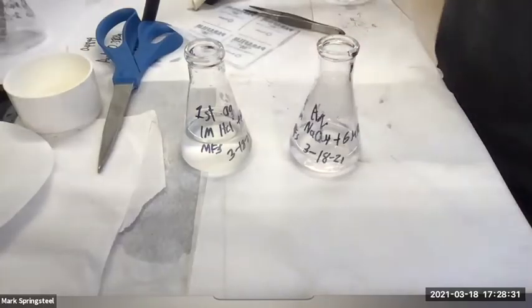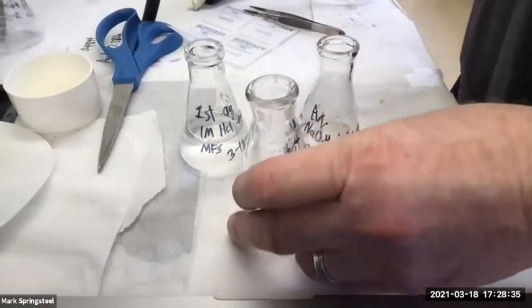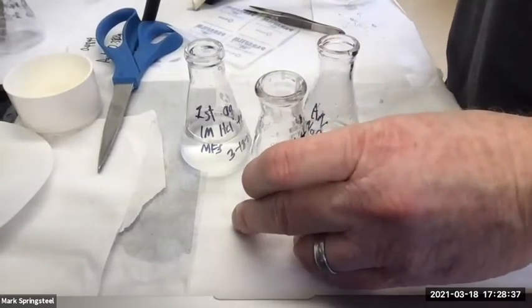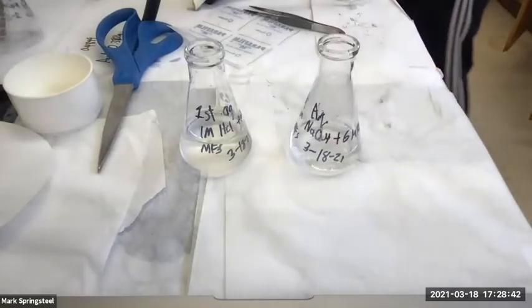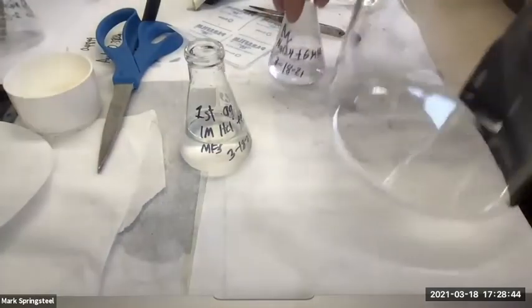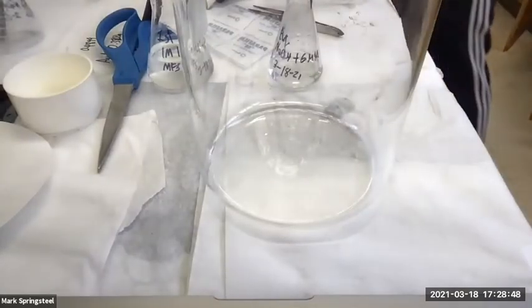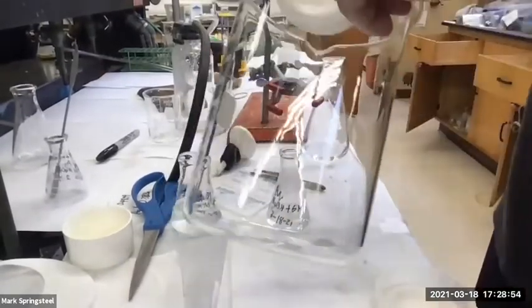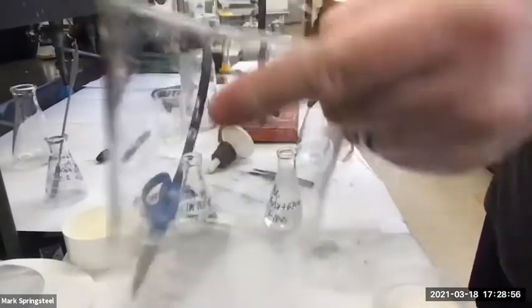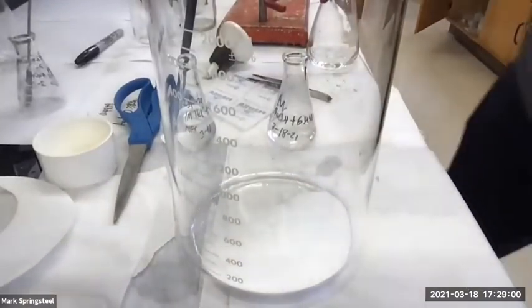And should I put the sodium bicarbonate in like a small Erlenmeyer flask and add the acidic solution? No. Why not? If you want it to shoot out the top, then yes. Yeah, it can volcano out, huh? So instead, get a big beaker. And then just grab a little sodium bicarb. Pour that in. With experience, you know how much to add. And I can add a little more too.